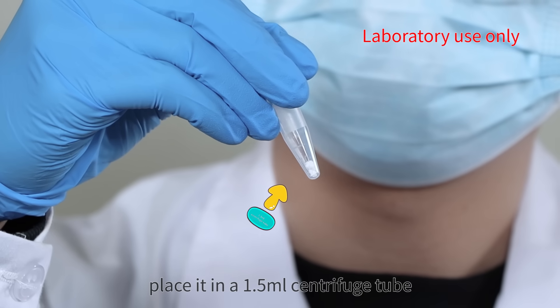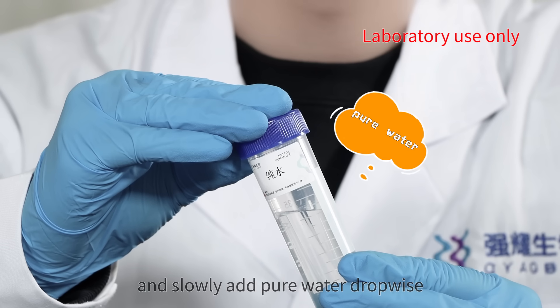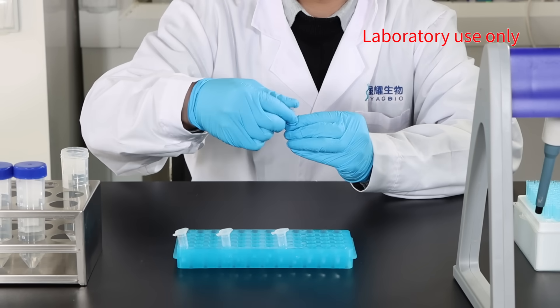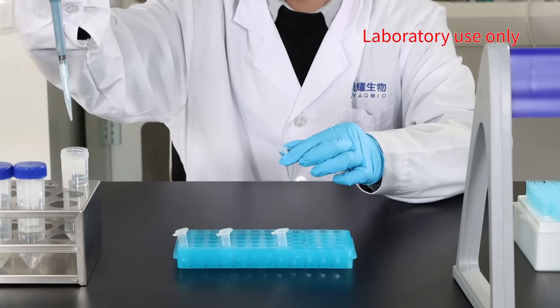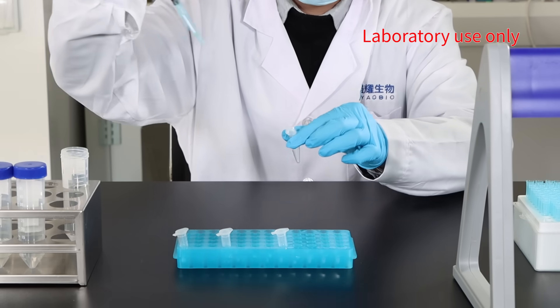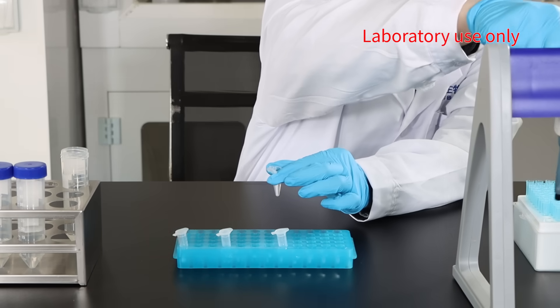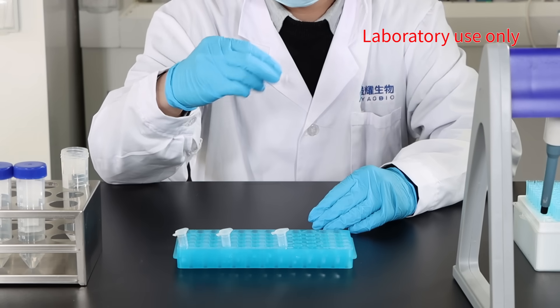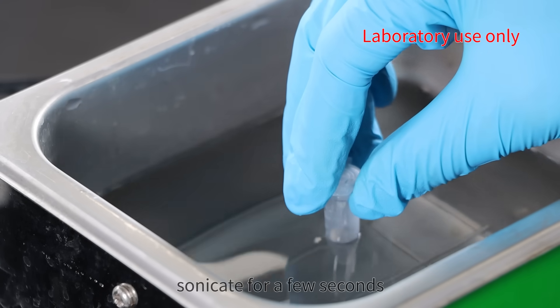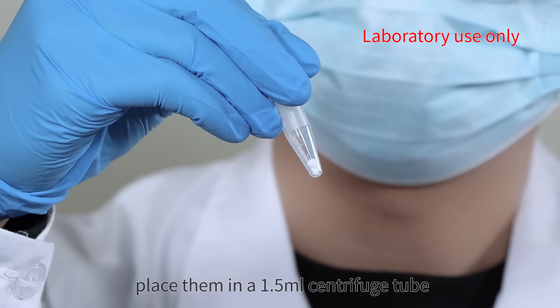Place it in a 1.5 milliliter centrifuge tube and slowly add pure water drop-wise. Cover the lid, shake slightly, and if necessary, sonicate it for a few seconds.